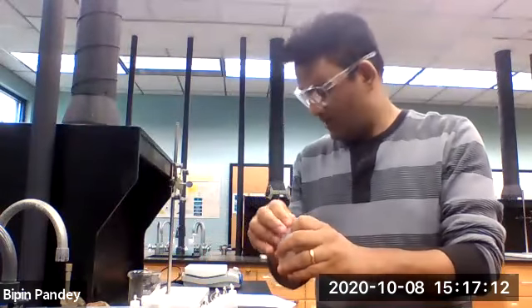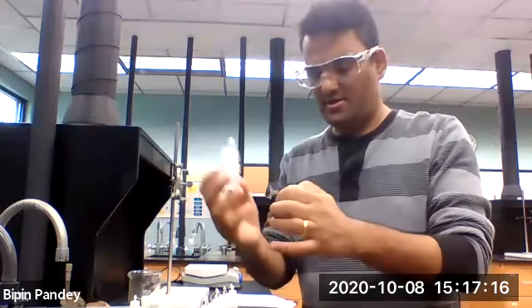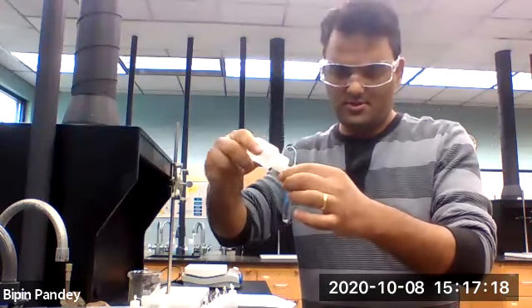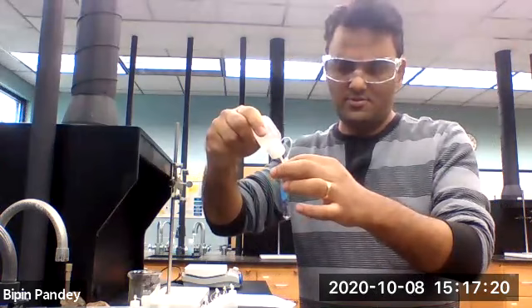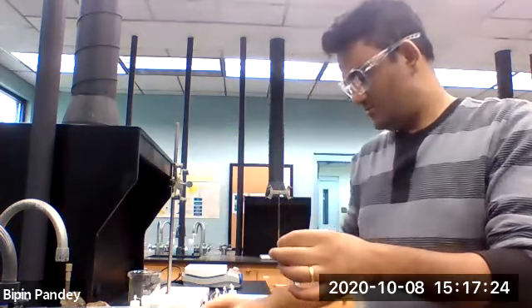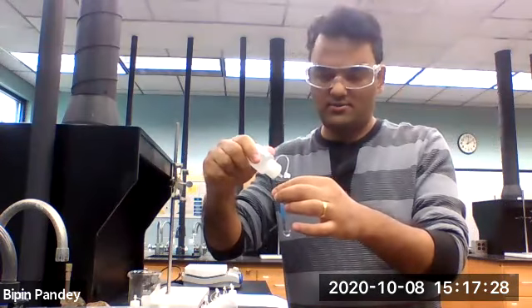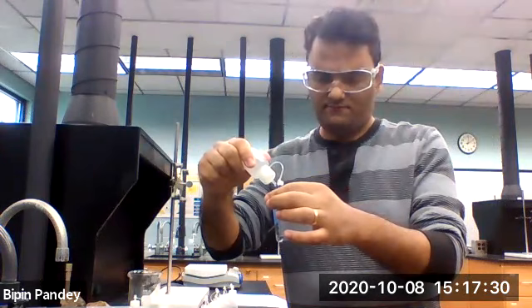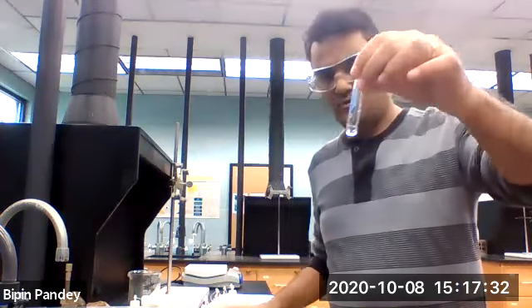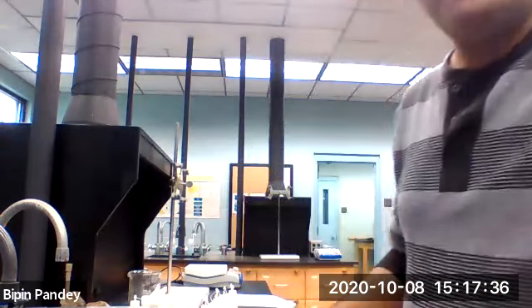So sodium chloride is a clear solution, right? So add 5 drops. 1, 2, 3, 4, 5. Solution is clear, no reaction.